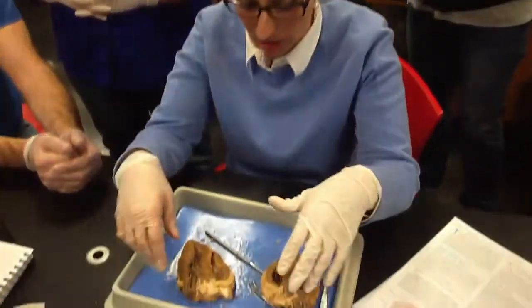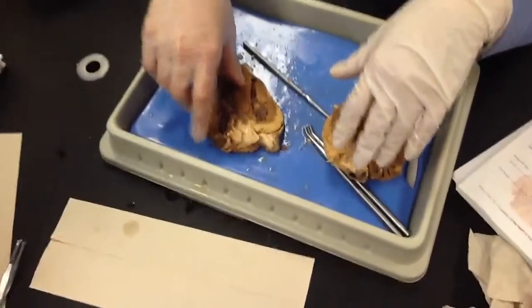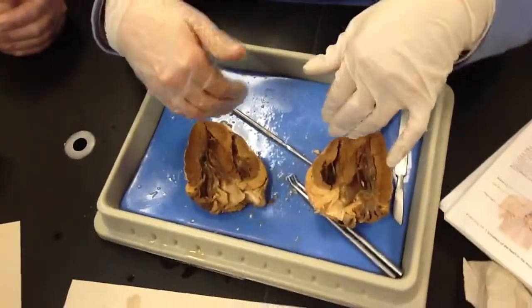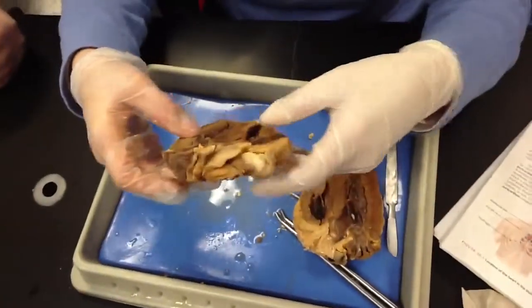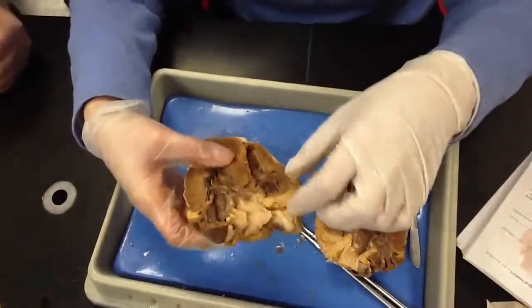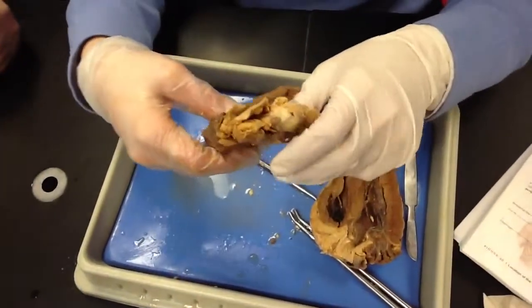Okay, so from the tissues to what? From the tissues, we want it to become oxygenated. So we know it wants to go to the right side, through the superior vena cava. So that means we need to go to the right side. It didn't go out the aorta yet, did it? Well, I sort of started all over, because I lost track of my thoughts.